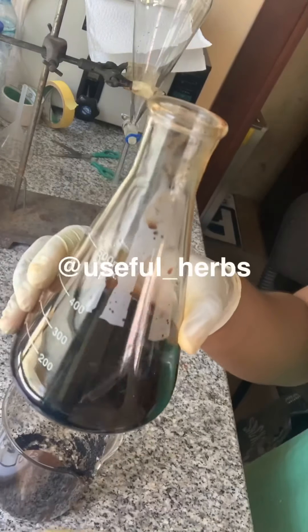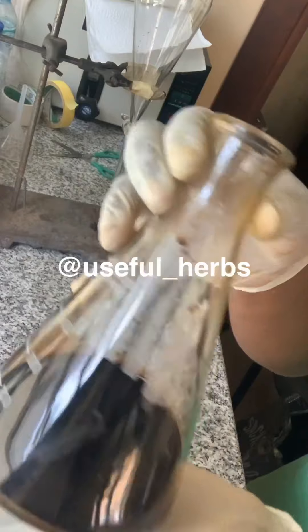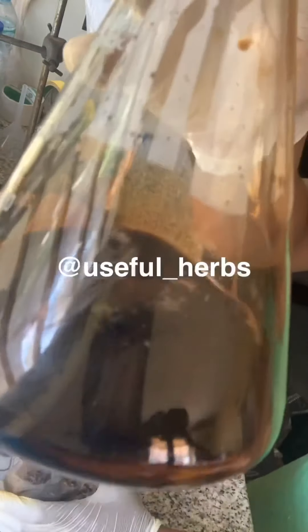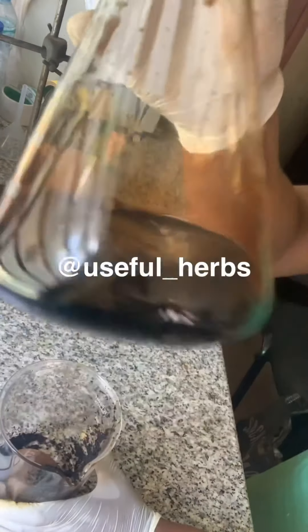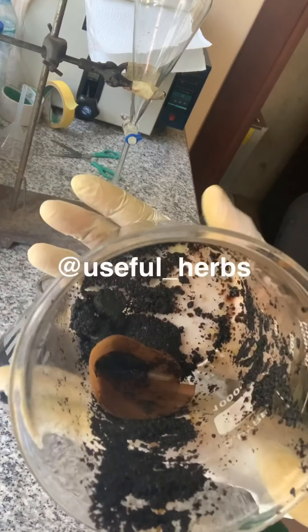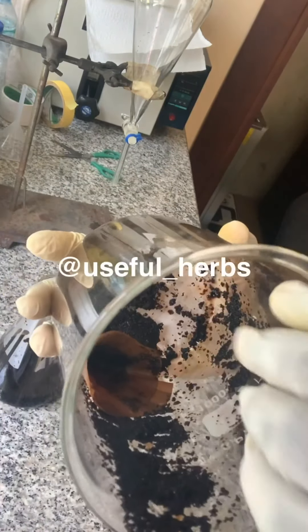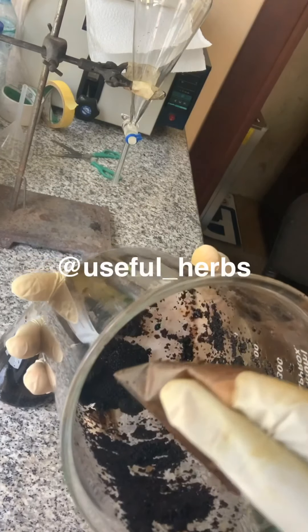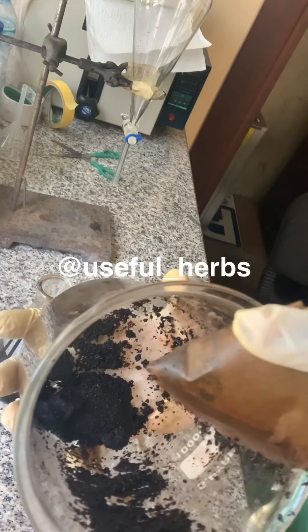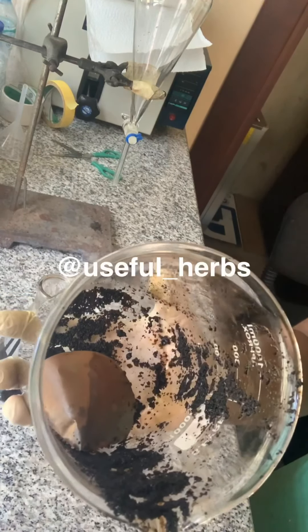Like you have seen how I prepared this extract. Okay, now this is the filtrate, it's liquid. And this is what we call the residue. These are the tea leaves that are remaining. That's the filter paper that I use to filter the tea.